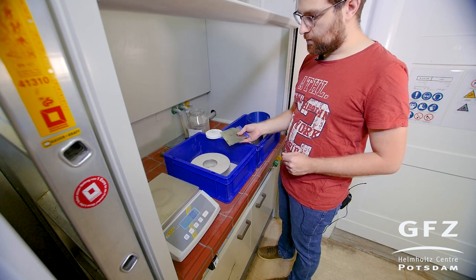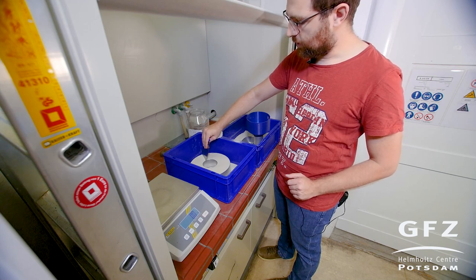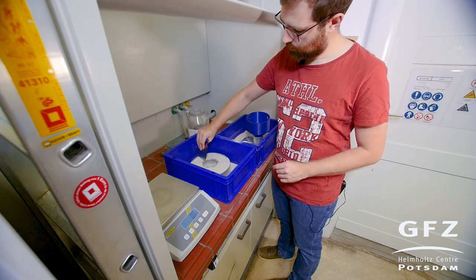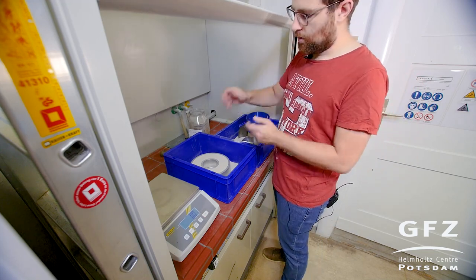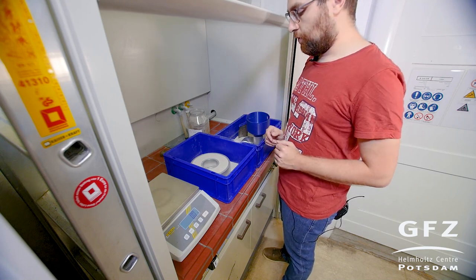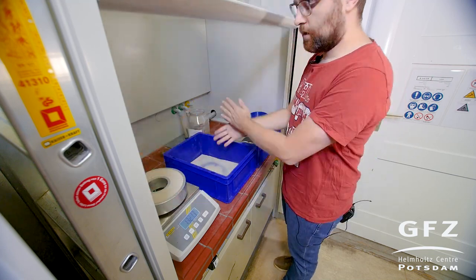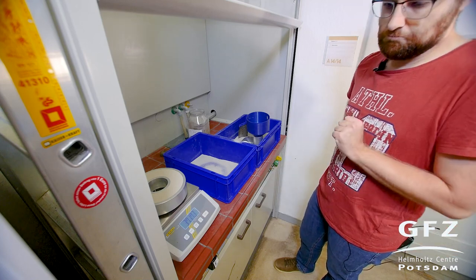Then we use a Japanese spatula to scrape off the excess material — it should be absolutely flat. We use a special scraping motion to remove the material without compacting it too much. Now we have to weigh the sample including the shear cell because the apparatus needs these values to compensate for normal stress changes. We can also measure density because the volume of the cell is fixed and the machine will give us the granular density as a readout. The reading is 3717.2 grams.